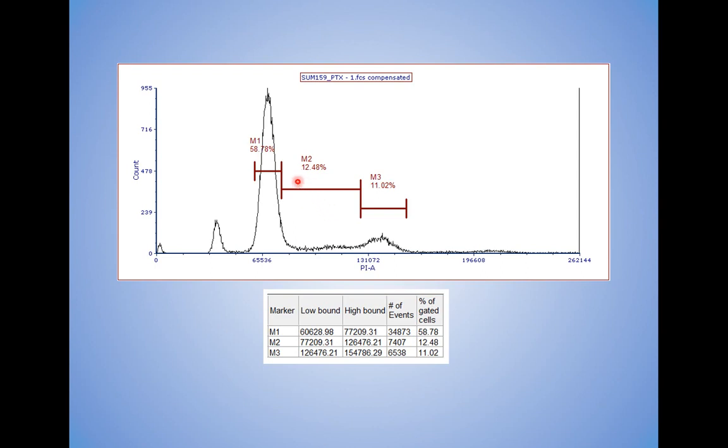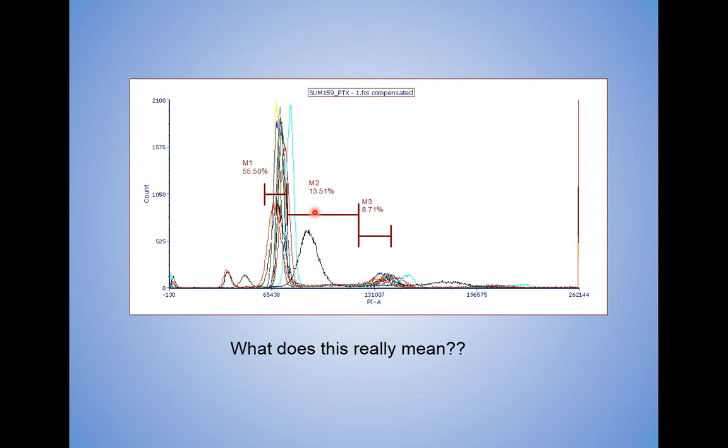But here's the bigger problem. This is 1. Okay, just for ballpark for 1, that's okay, but I have 12 files. So I got 12 files now, all laid onto this. Now, actually, I would need to have 12 separate histograms, of course. But what does this really mean? I have 3 manually placed regions, 12 files. It means I have 36 regions I need to manually position and make sure they're as accurate as possible. This is where this analysis starts to break down.